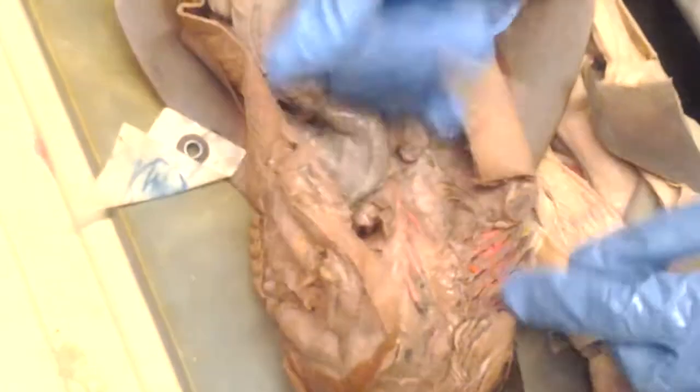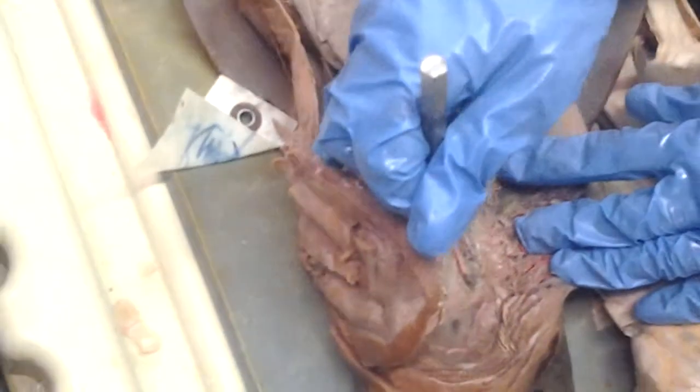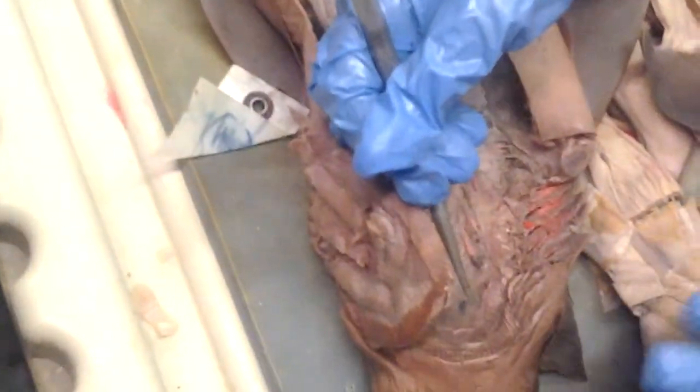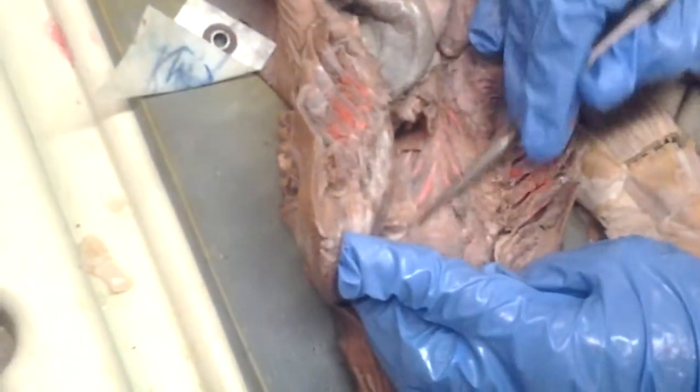So if the pin is here, you should be able to know. Do we need to number them or can we just say efferent? I know there are one, two, three, four. Just say as much as you know. Okay, so I'll just say efferent branchial. No, these are the lateral dorsal aortae, but you don't need to worry about that.